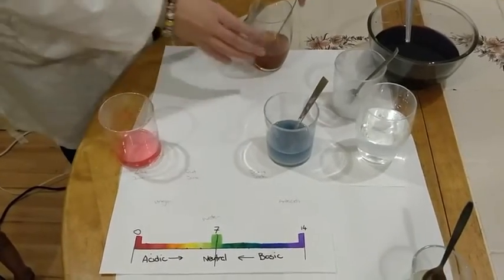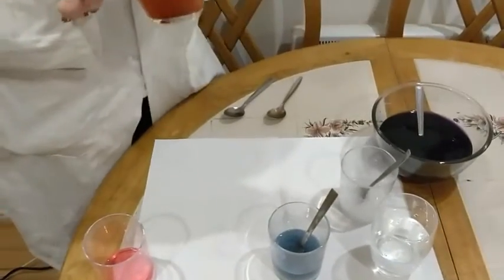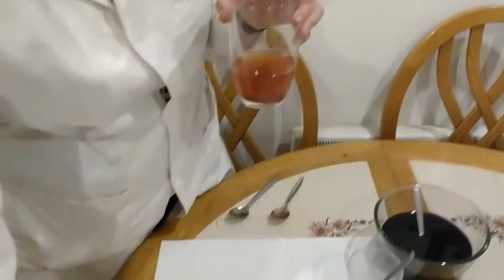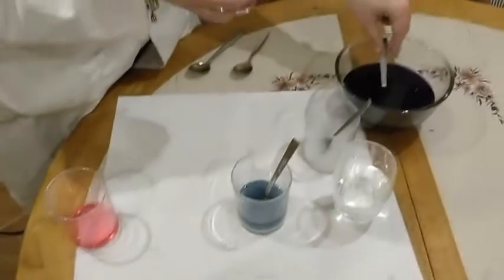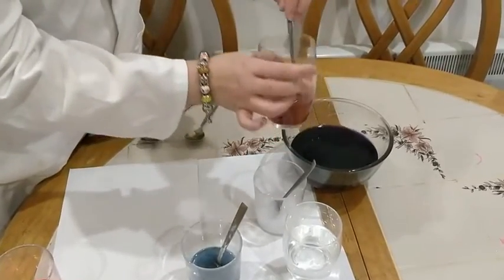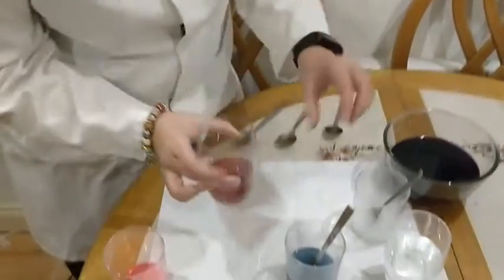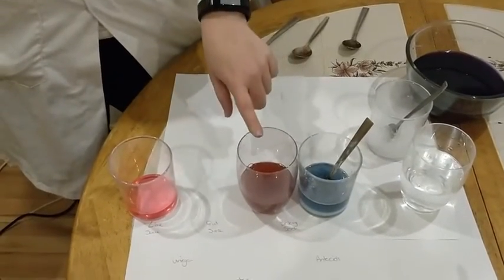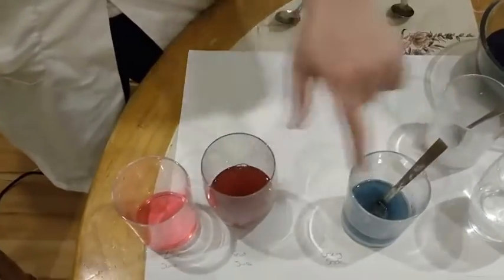Next we have our mixture of fruit juices. Because this is already brown in colour, we may not get the desired result, but it should be falling somewhere within this end of the pH range, because fruit juices are very acidic. If I add some now, I'm going to add a little bit more, and I'm going to stir. It has darkened in colour, and we can compare it to our bread soda. We have very clearly a base, and we have very clearly an acid. So our acid is going to go beside our vinegar. We're getting even a colour gradation so far.